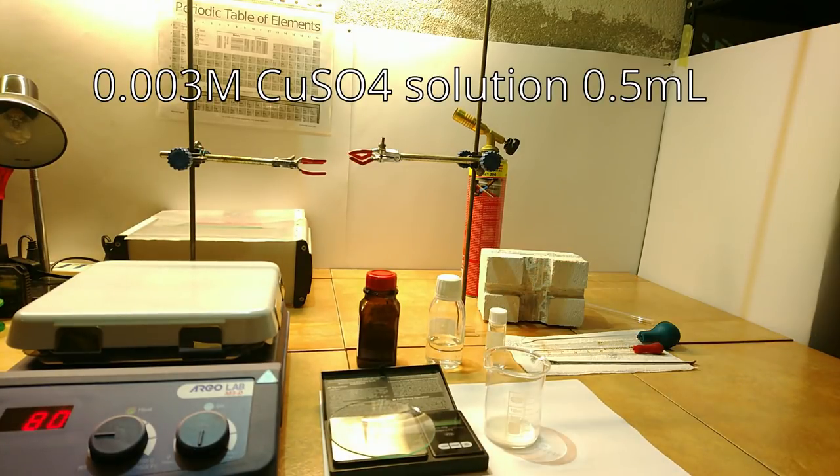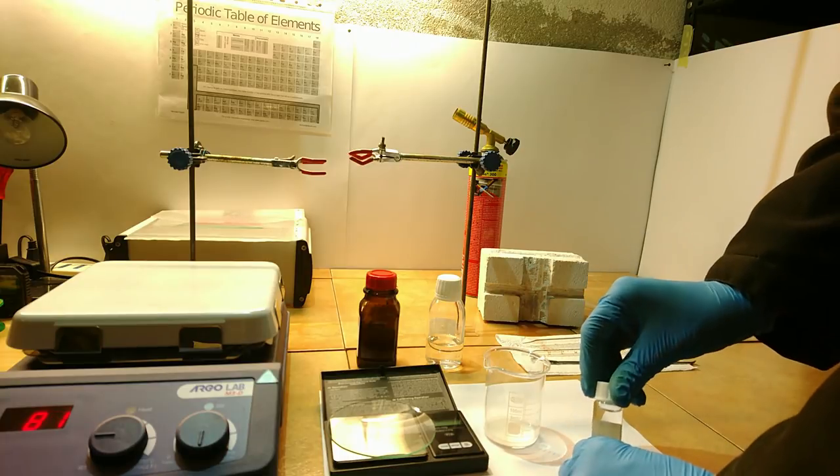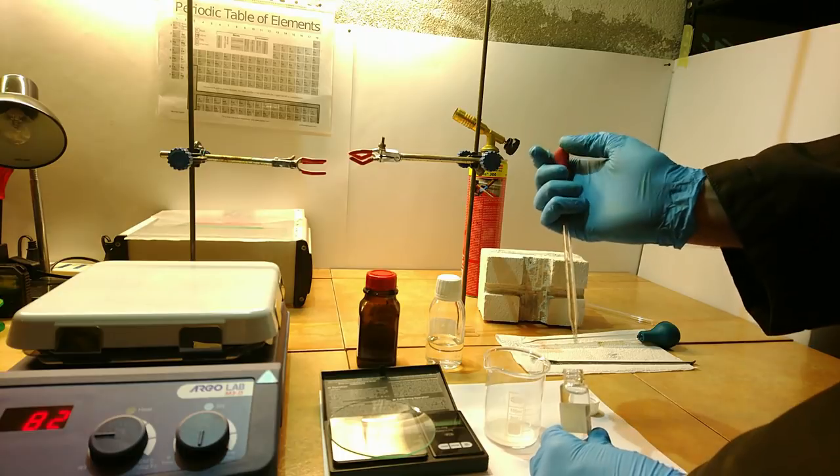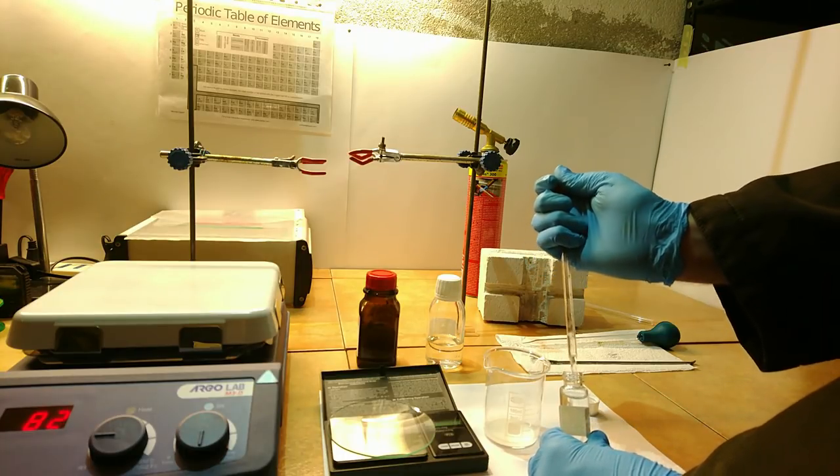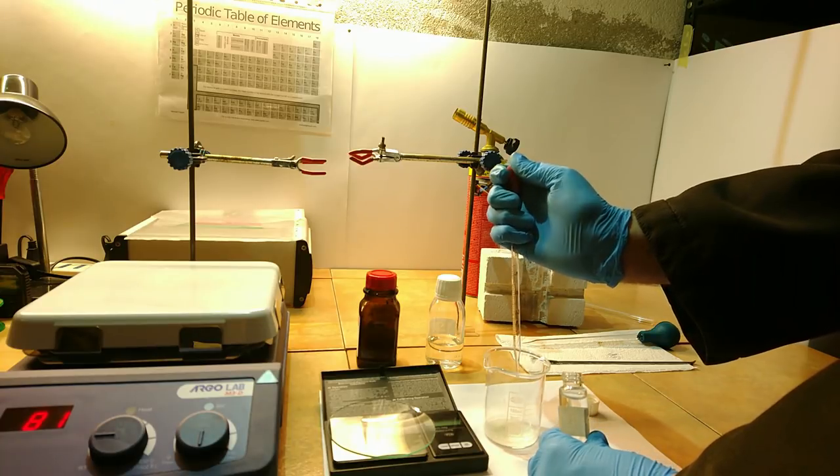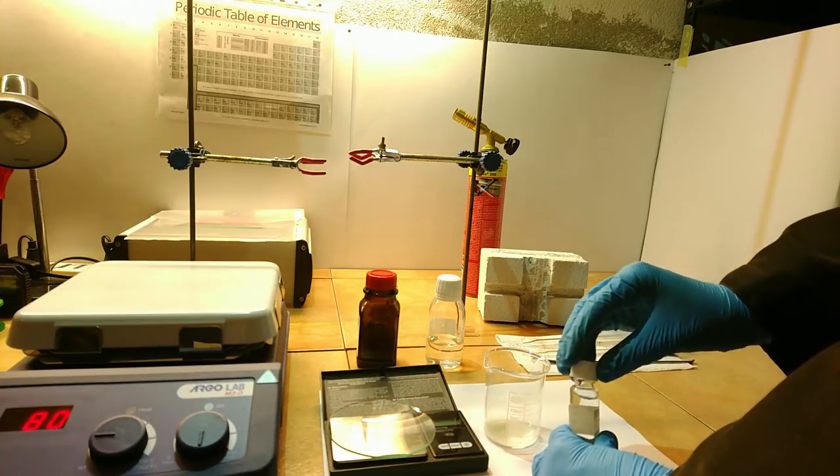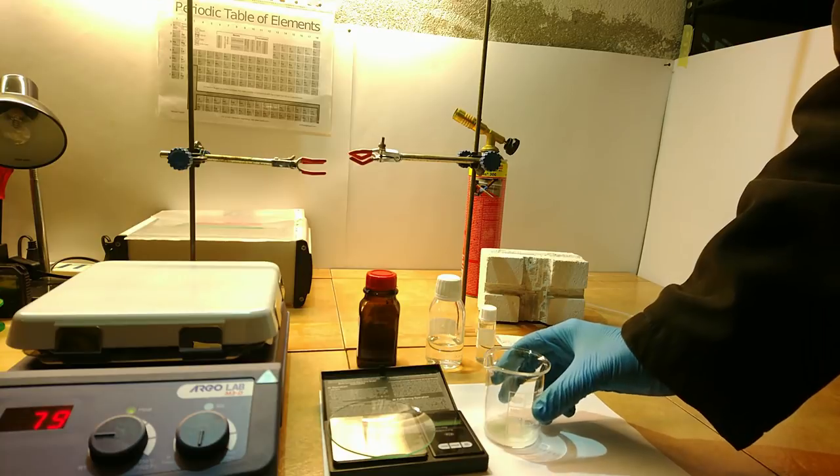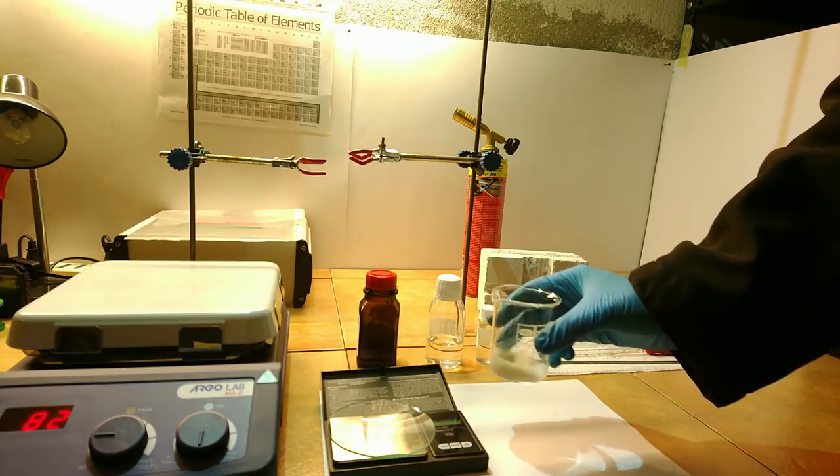To this add 0.5 milliliters of a 3 millimolar solution of copper sulfate. Copper sulfate actually is supposed to be blue, but this is a very dilute solution.